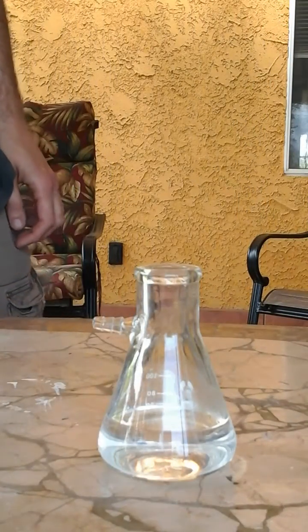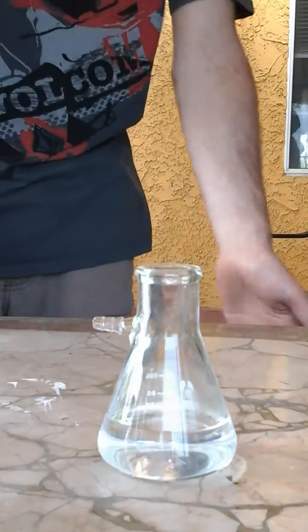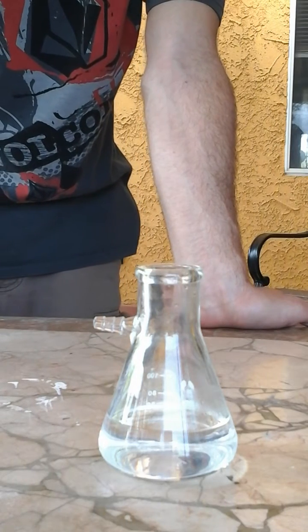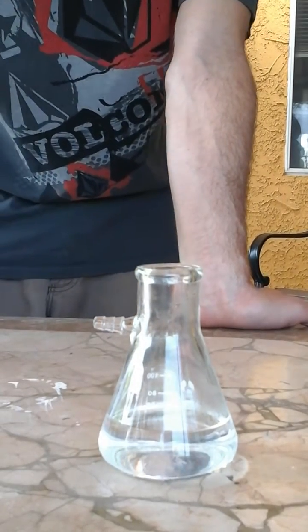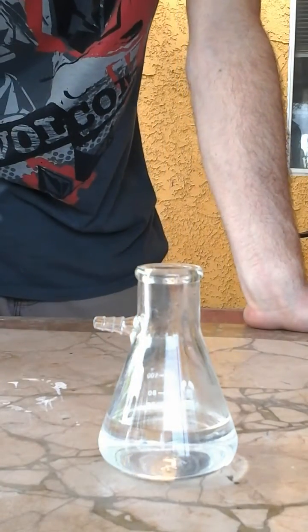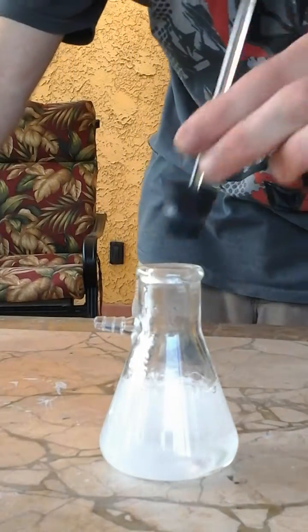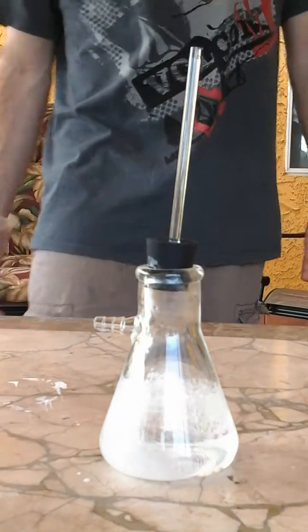So 50 milliliters of formic acid. The rule of thumb is one part sulfuric acid for every two parts formic acid, but regardless of how much formic acid you have, the sulfuric acid will react with whatever formic acid is there, producing carbon monoxide. And you can see the intense bubbling — that's the formic acid dehydrating and producing carbon monoxide.